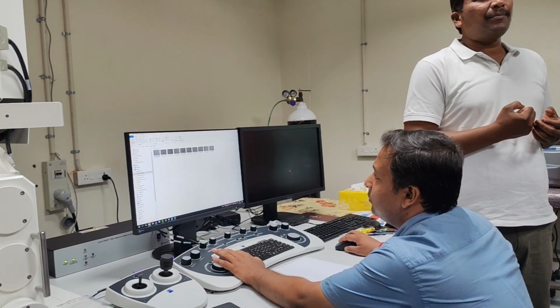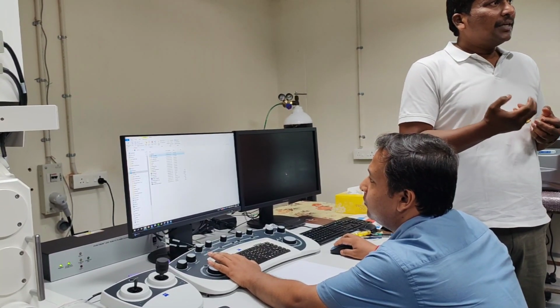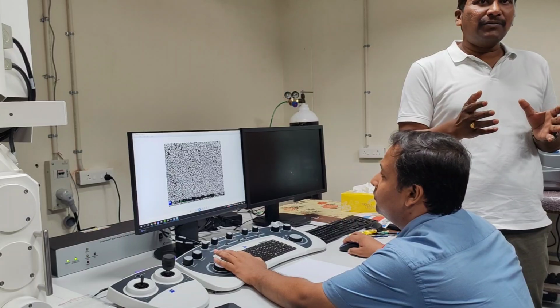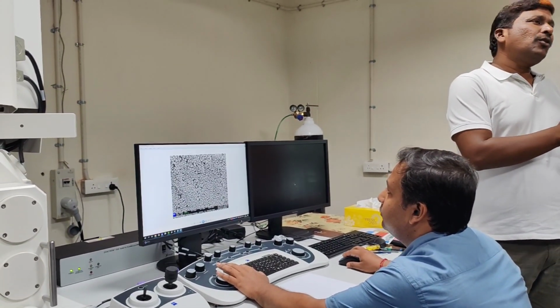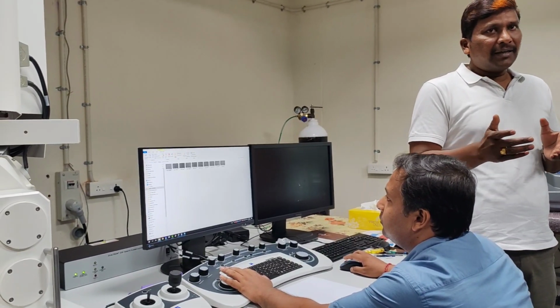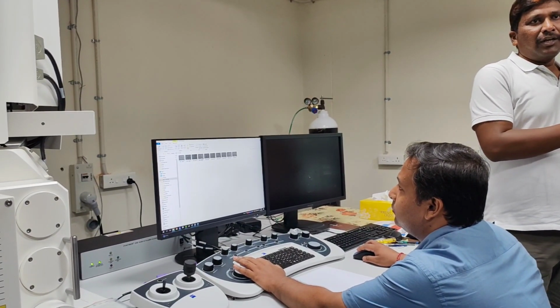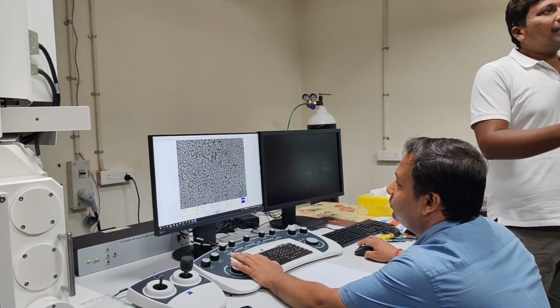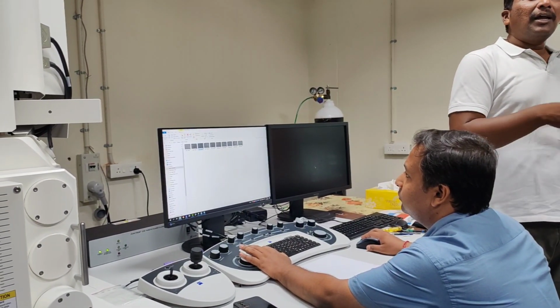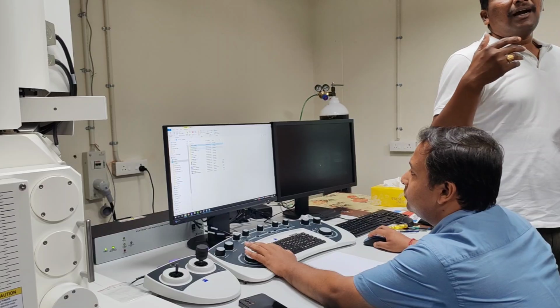You can freeze the sample up to a certain temperature. There are different cooling stages that allow you to go down to -50. The cryo stage can go down to -189, because here we are using only the Peltier technique, but there we use liquid nitrogen. So that's a separate technique, but definitely biological samples, or those who are working on tissue, like to handle the samples in a different way.